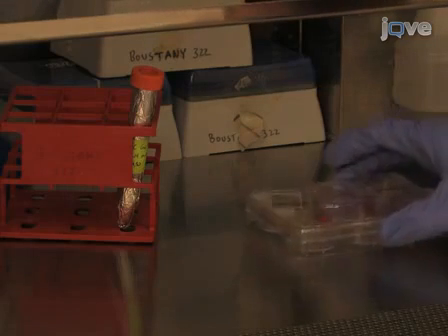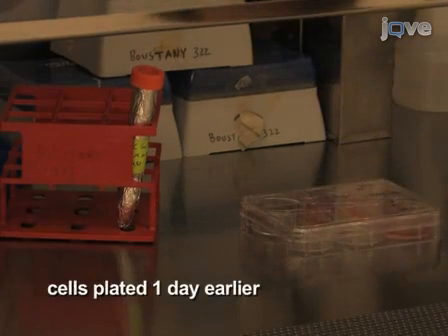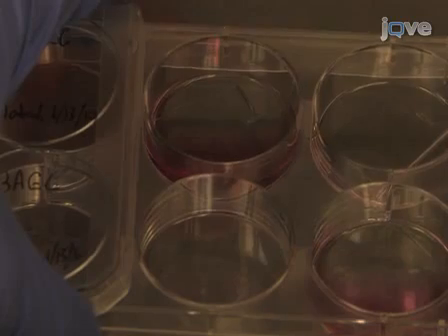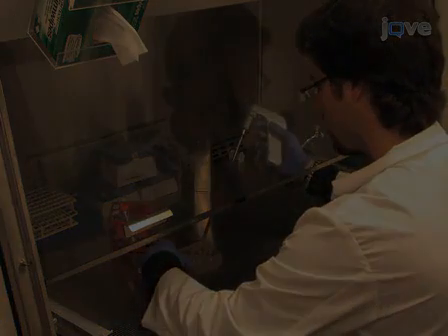Next, place a 6-well culture dish with cells plated on cover glass under the hood. Using a Pasteur pipette connected to a vacuum line, remove the cell medium from the wells. Then immediately add 2 milliliters of the labeled medium to each.